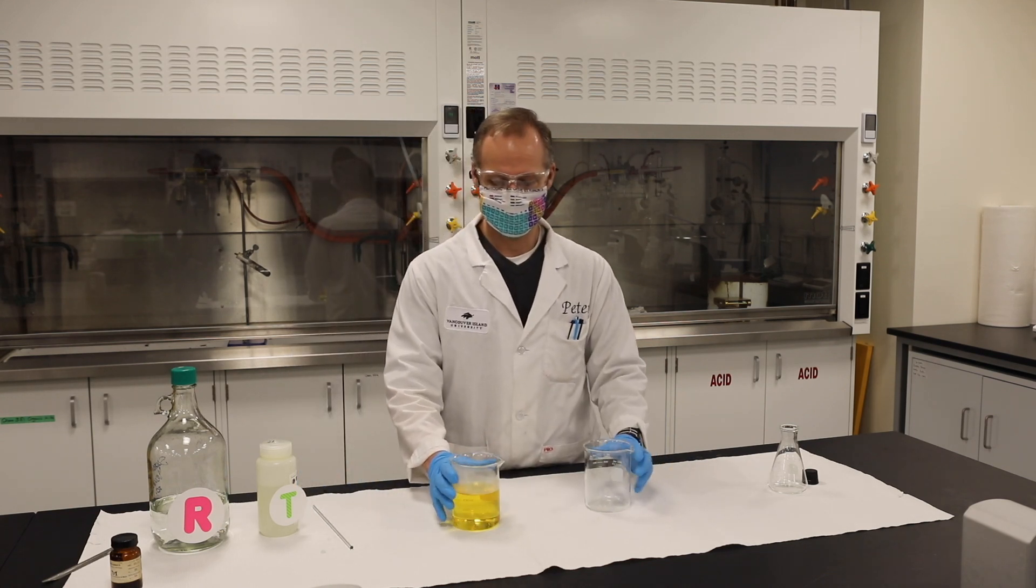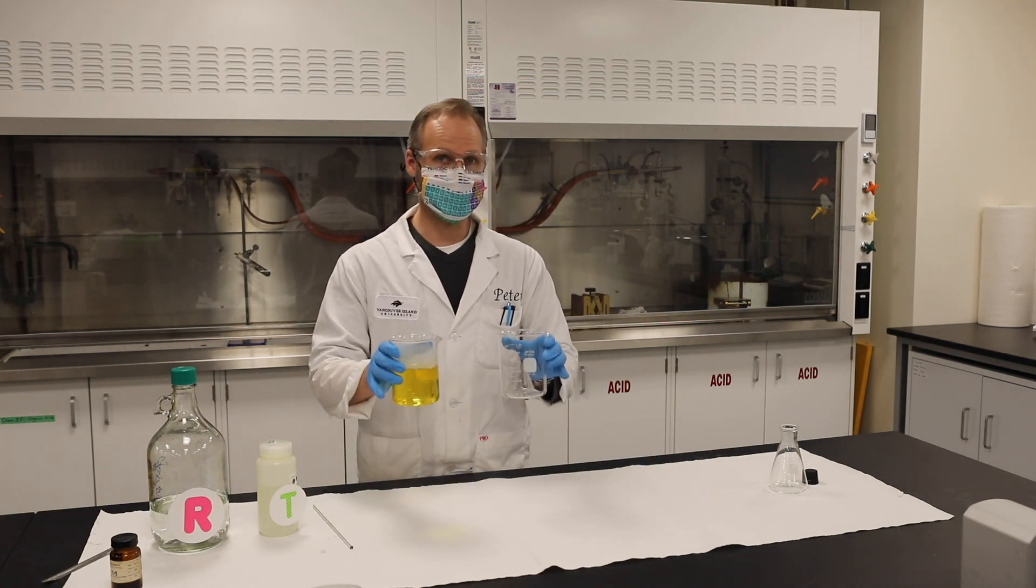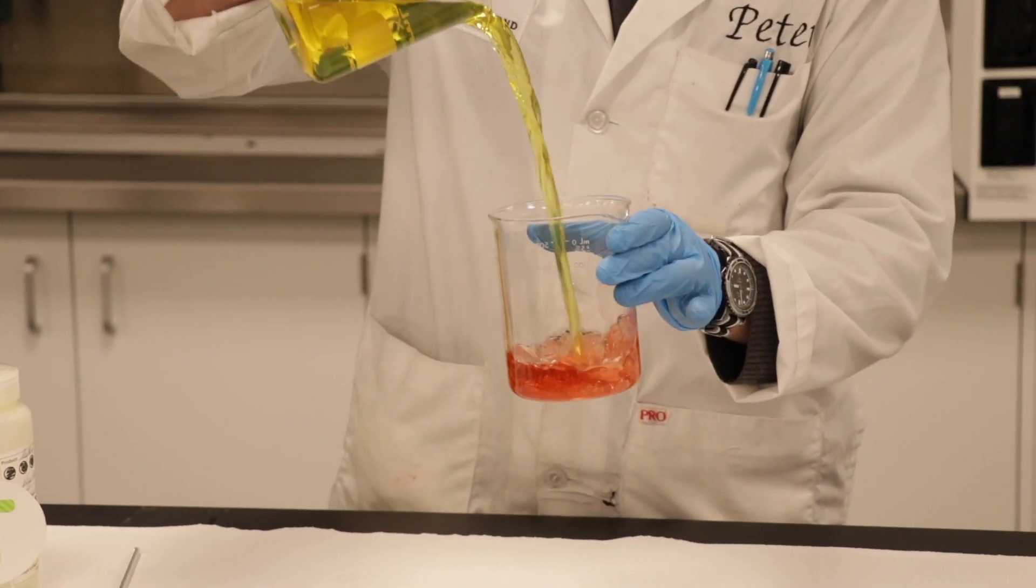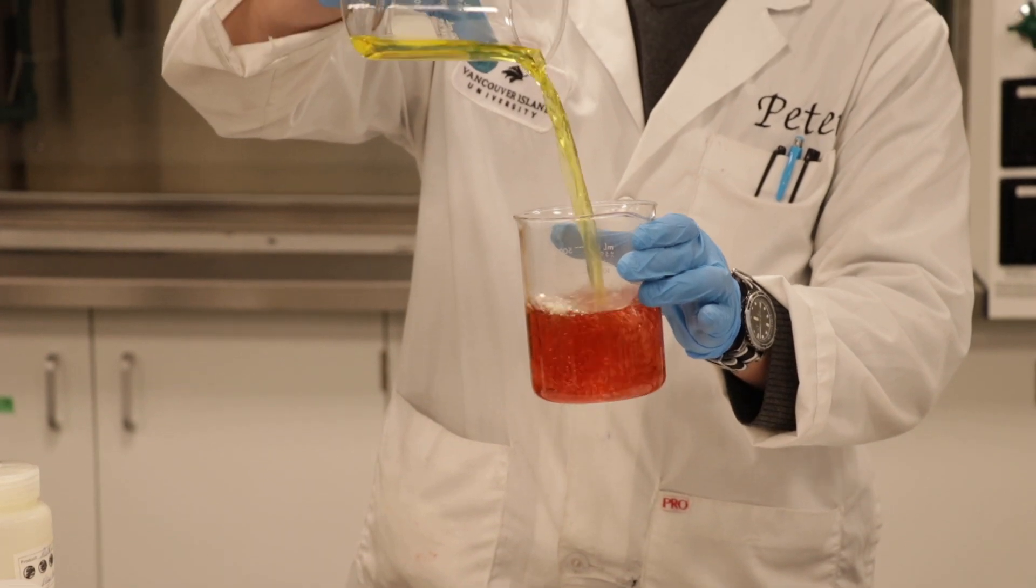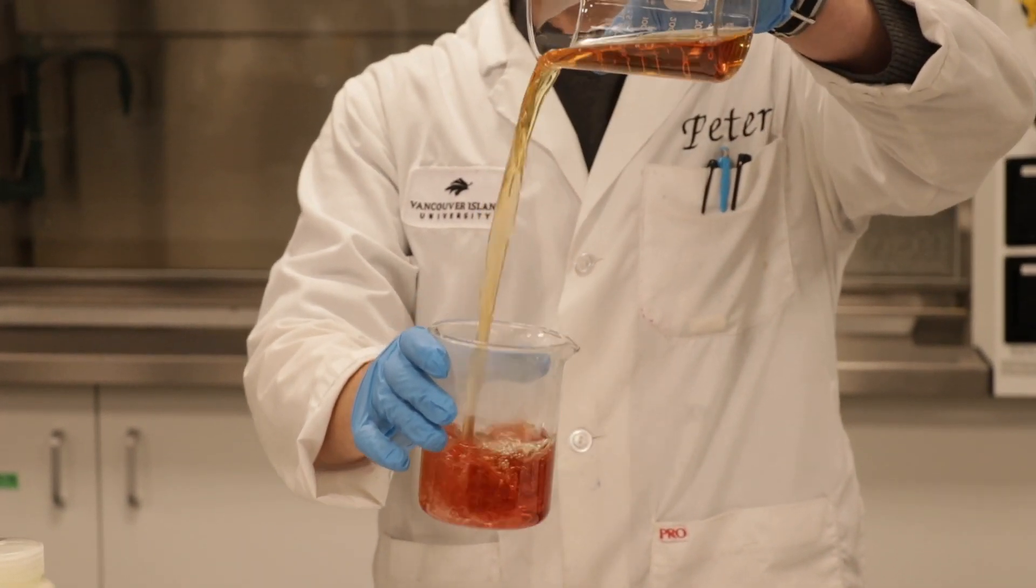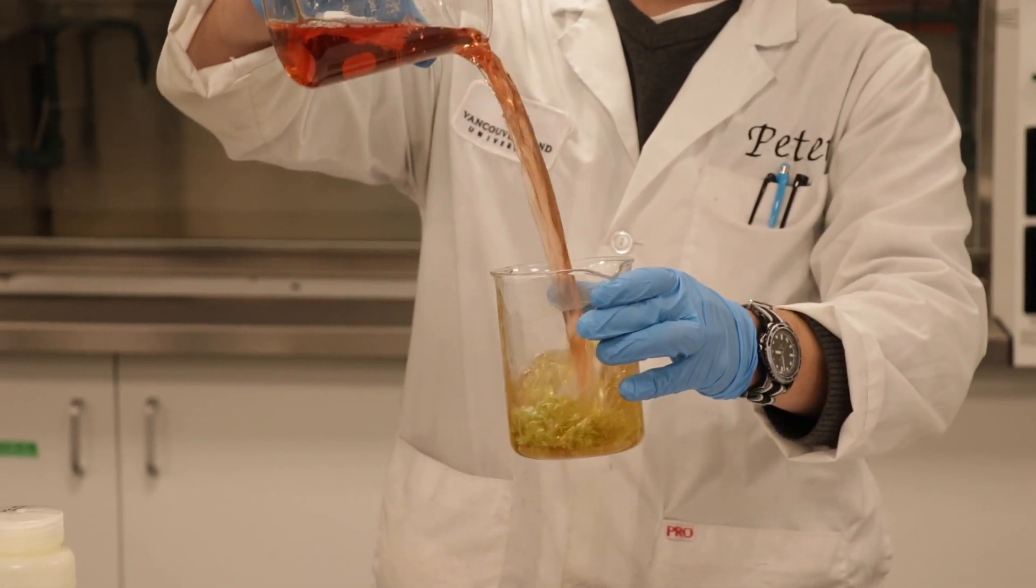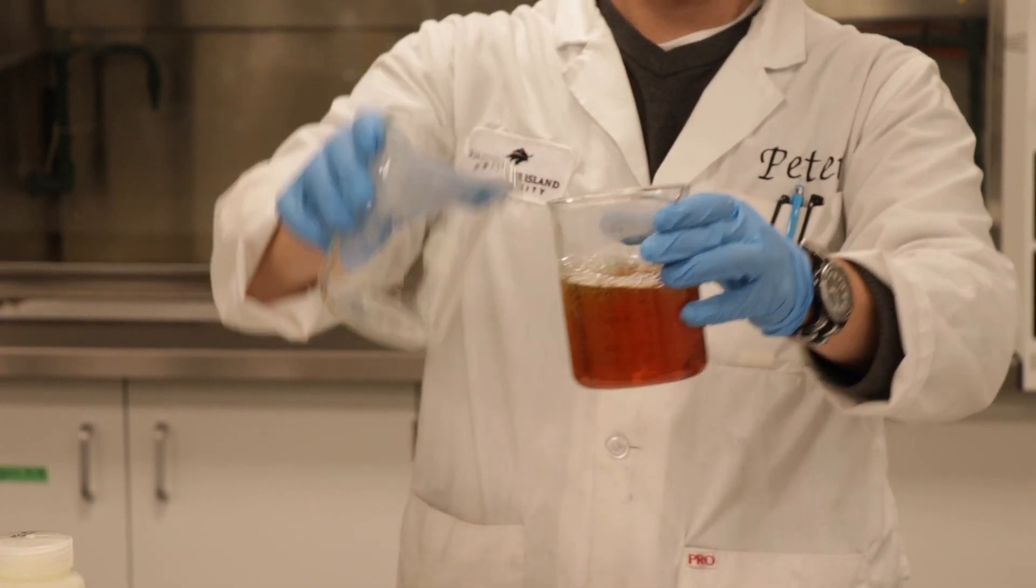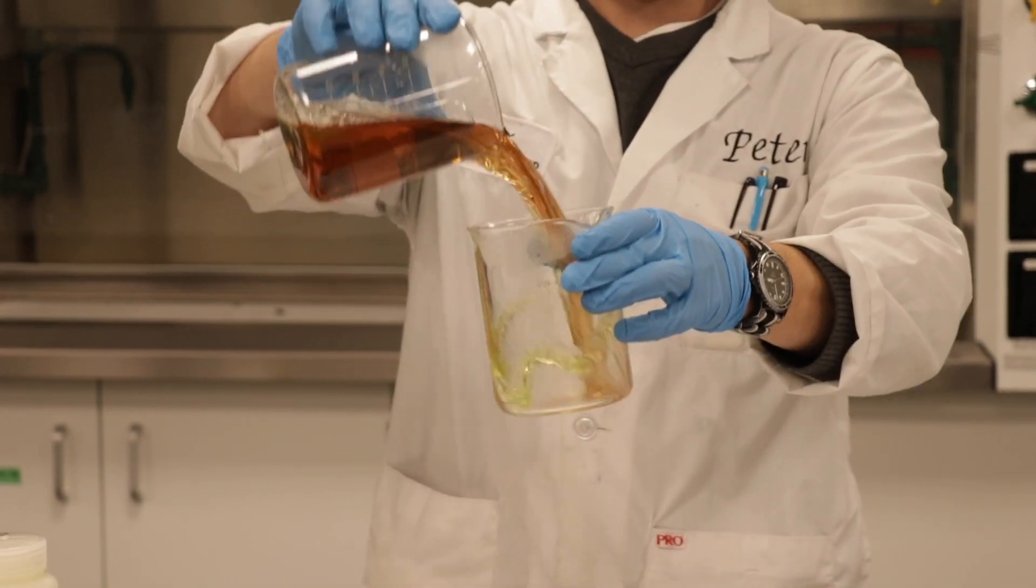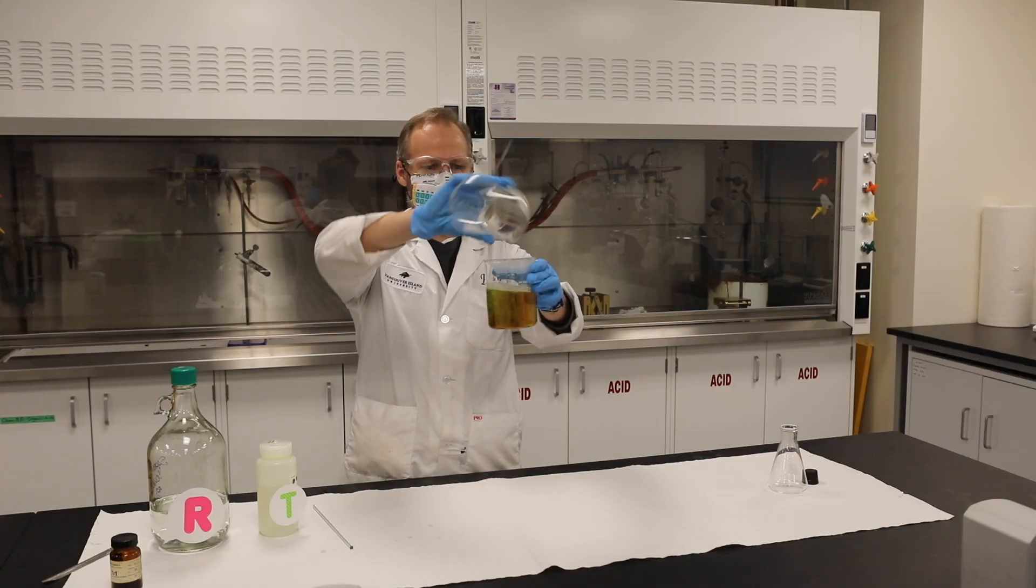So now, this is also called an oscillating reaction, by the way, because it goes back and forth. So let's see what color is, let's see if we can make it go to green. Yep, almost getting there. A little bit more, just about complete, but almost like a chameleon.